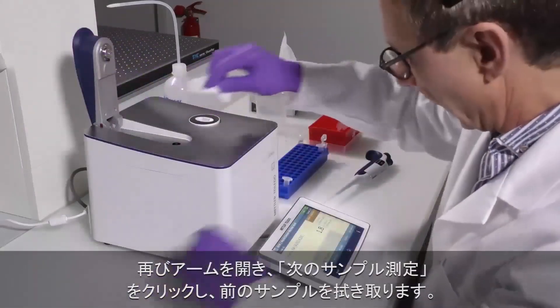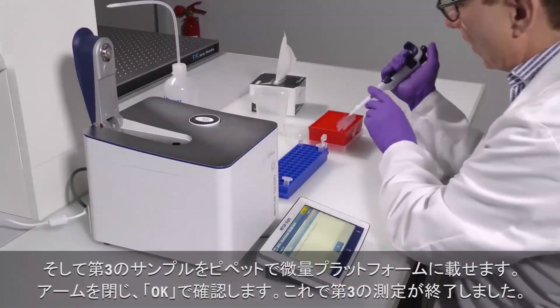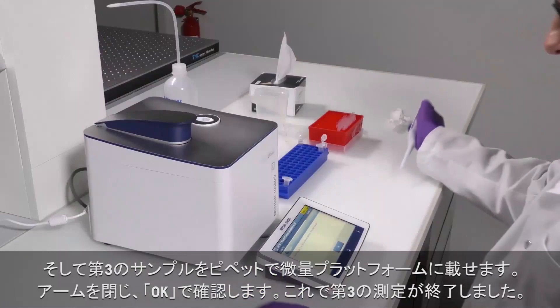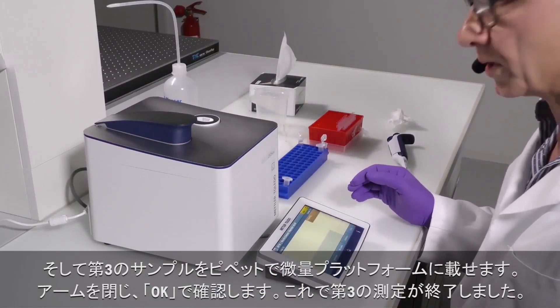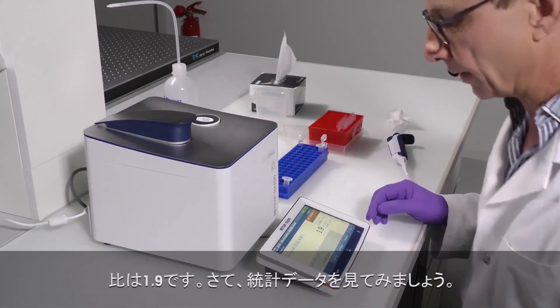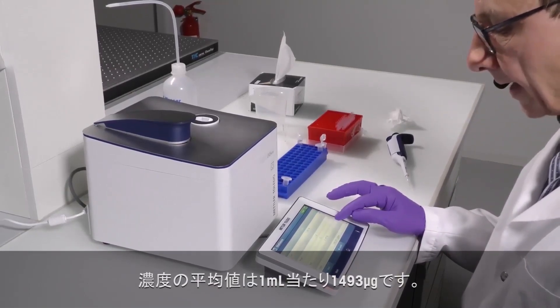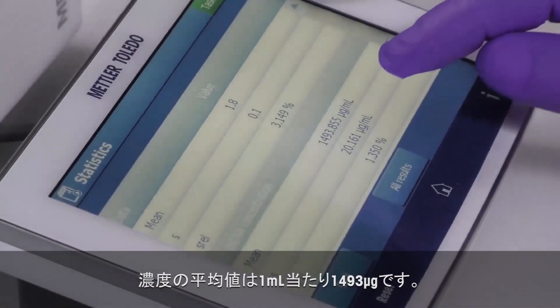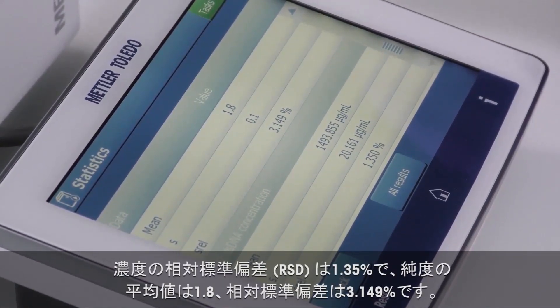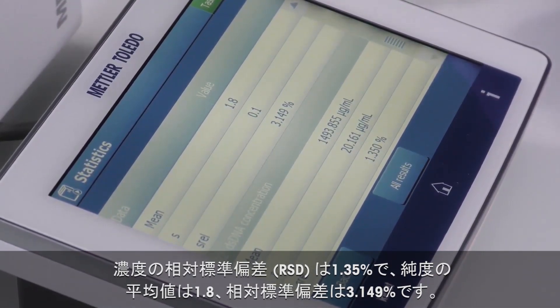I open the arm again and say next measurement. I wipe the previous sample away and pipette the third one onto the microvolume platform. I close the arm and confirm. The third measurement is done. Now you see we have a slight deviation — the ratio is now 1.9. At the end we can have the statistics displayed by clicking on Statistics. The mean value for the concentration is 1493 micrograms per milliliter, the relative standard deviation for concentration is 1.35%, the mean value for purity is 1.8, and the relative standard deviation is 3.149%.